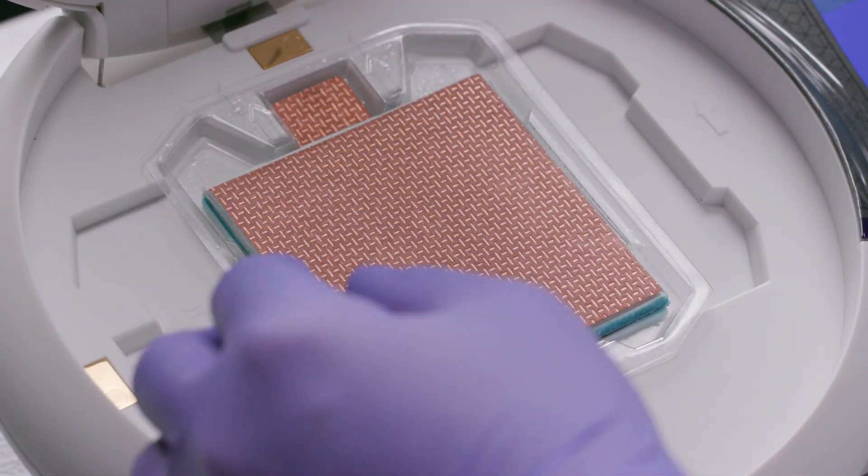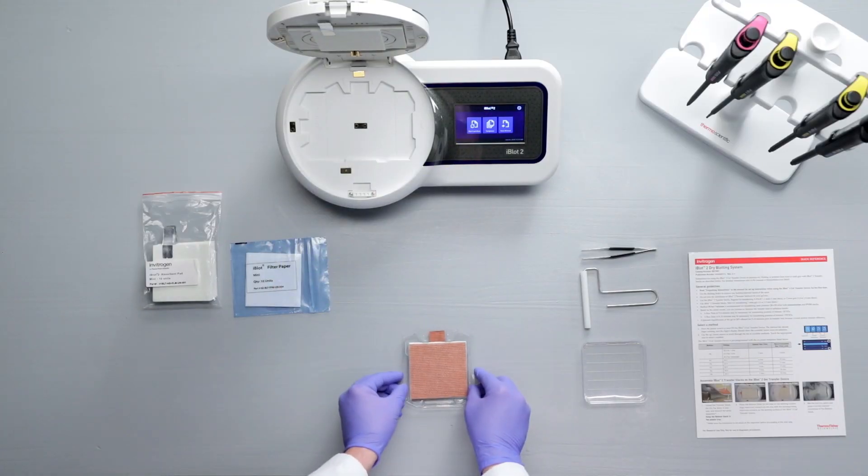To disassemble, open the lid of the device. Carefully remove and discard the top stack and gel.